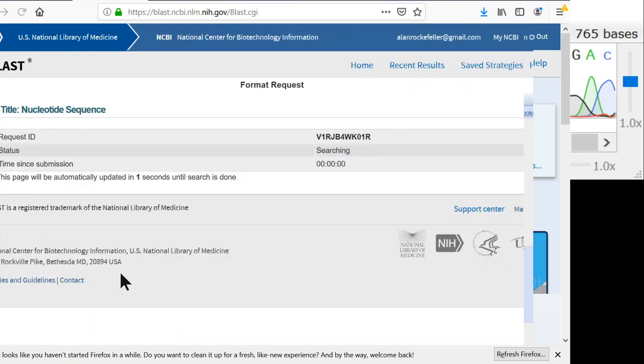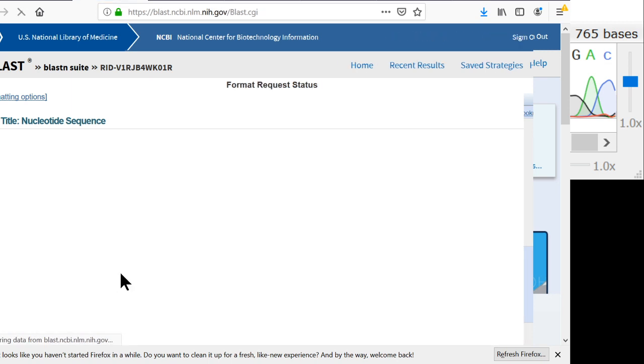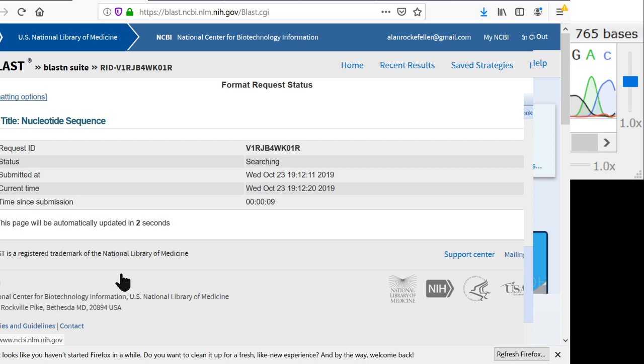So I just scroll down and click BLAST. This takes usually about 15 seconds. It's comparing my sequence with every other sequence that's ever been uploaded to GenBank. People from all over the world upload sequences, and anybody can upload sequences here. So we're searching through a huge number of sequences. Occasionally the server is busy, and it takes longer, but usually it doesn't take too long. Usually not more than 30 seconds.